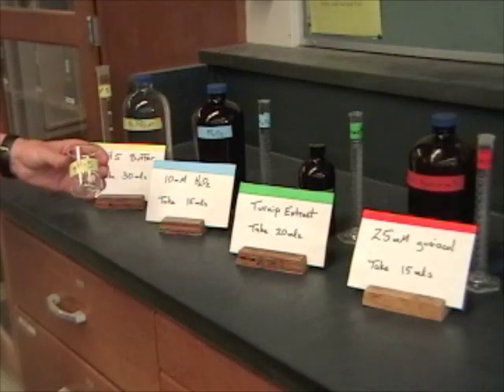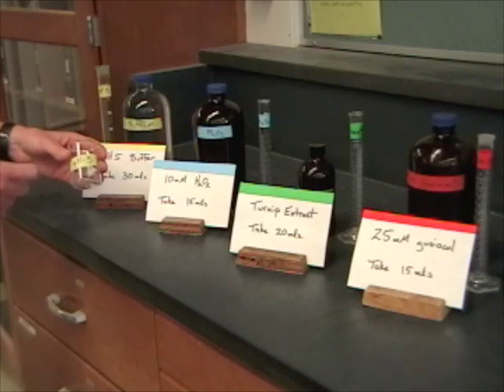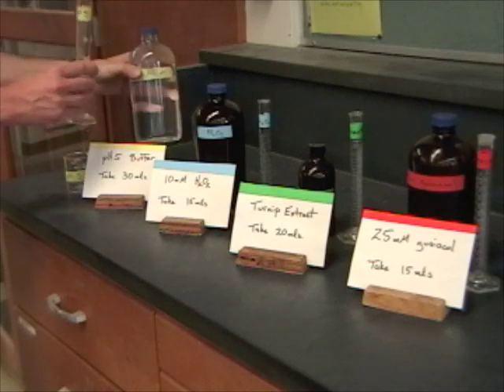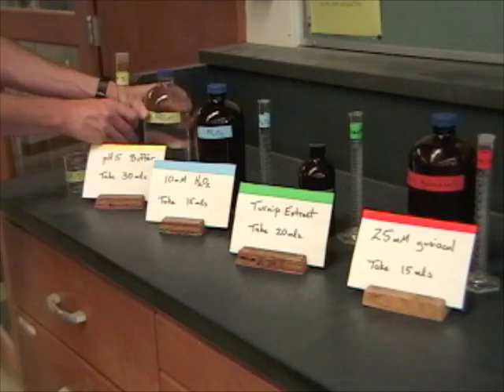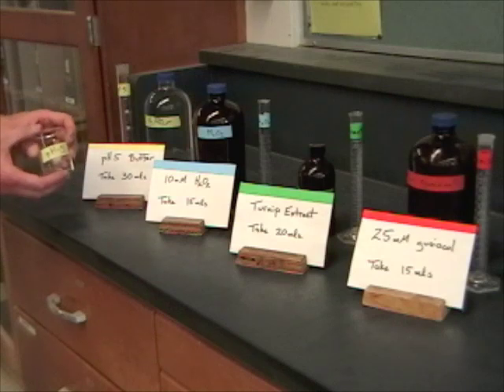For instance, here I brought my pH 5 buffer with the yellow tape, my pH 5 beaker with the yellow tape over from my desk, and I see here I need to take 30 mils of this back. So using the correct graduated cylinder, I'll measure out 30 mils of that, take this back, and this should be enough for the entire experiment.